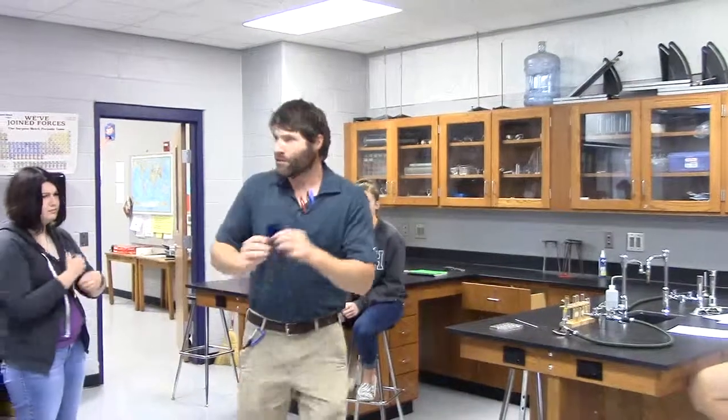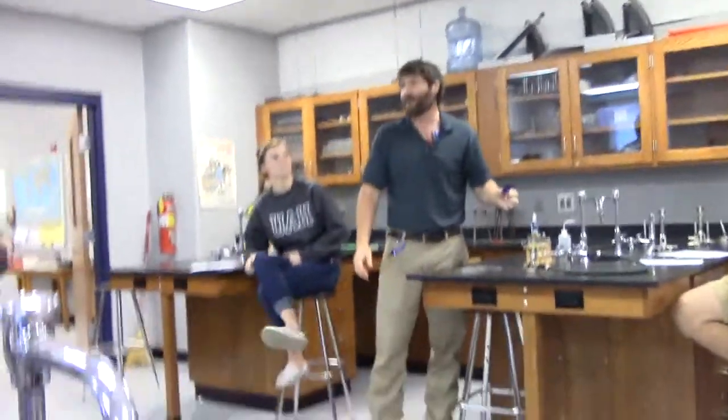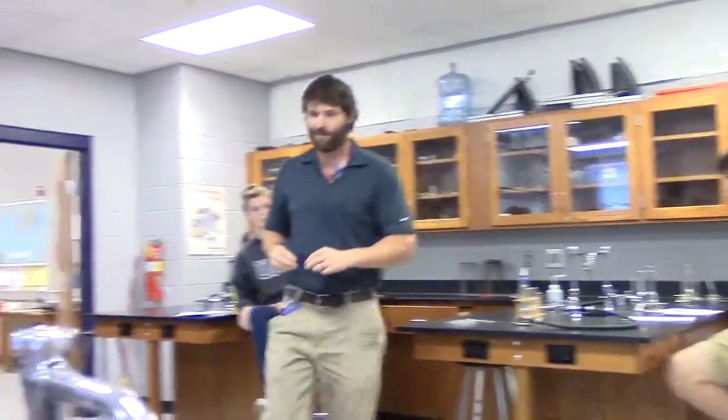Now, in my personal opinion, pretty much everything looks blue through the glass. But anyway, you're supposed to look through, and sodium and potassium will be distinct when you look through the glass. I'll be honest, one of them looks pinker than the other when you look through the glass at it. So it's a very easy way of telling sodium and potassium apart. And there's the pieces of glass laying over here.